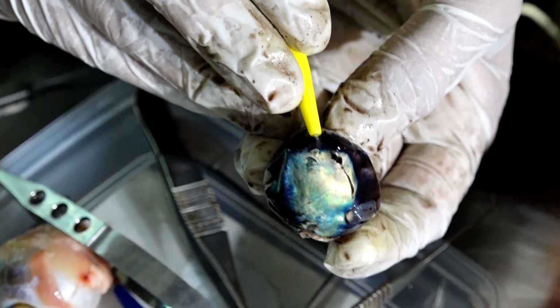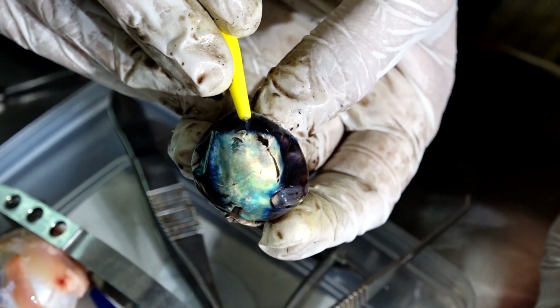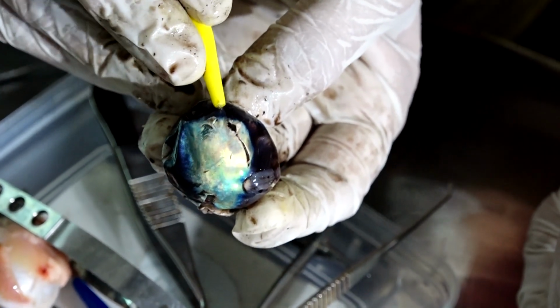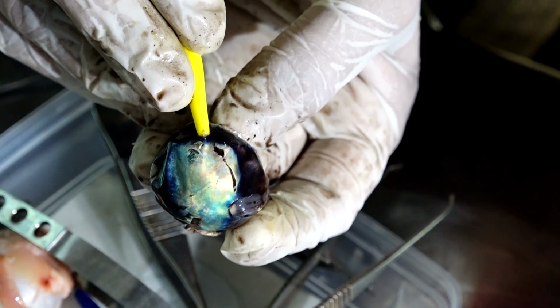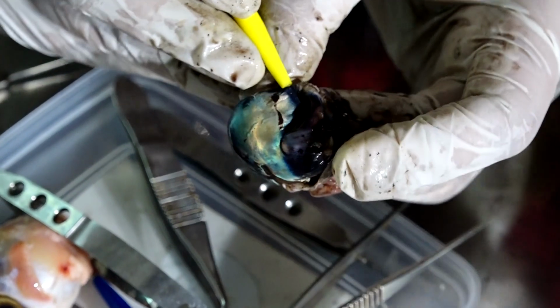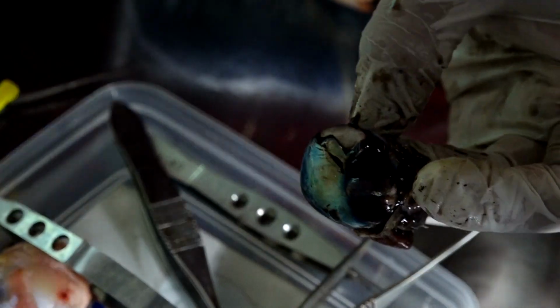So have you heard of retinal detachment? Retinal detachment is a condition in which the retina separates from the underlying structures. So this is where if I inject fluid, the whole retina will balloon up, and that ballooning of the retina is nothing but the retinal detachment. Okay, so we will try to just peel the structure.